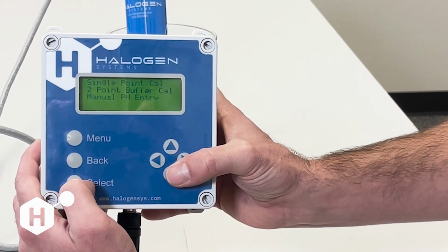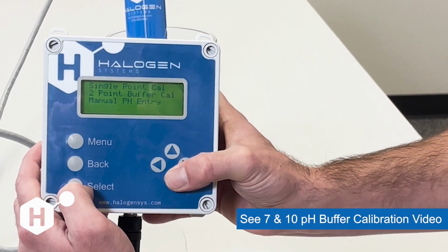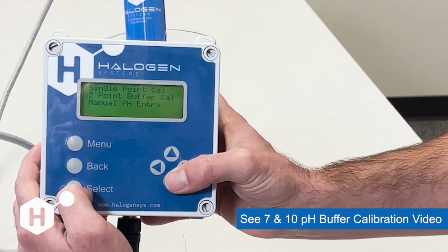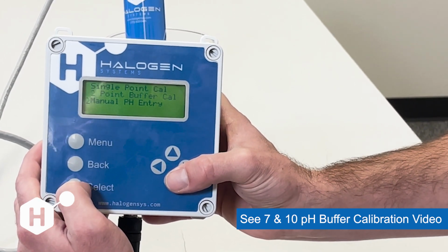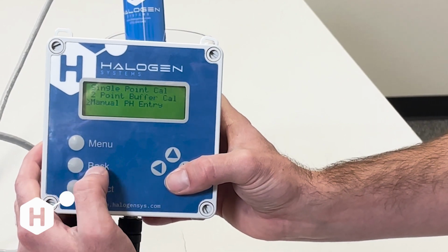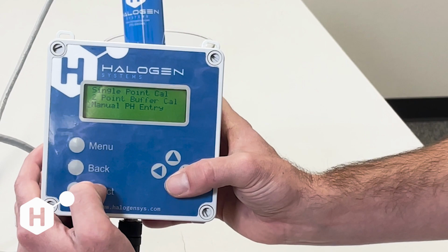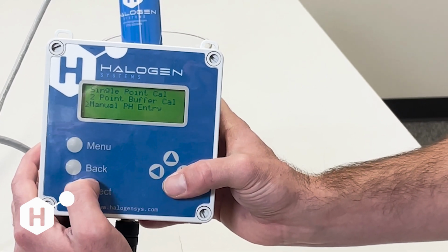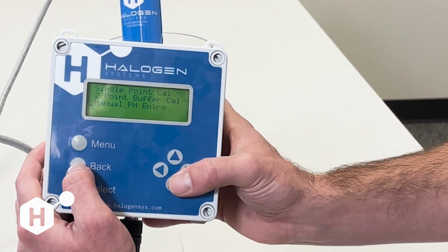We'll also be able to do 2 additional options for pH calibration, and that's going to be 2-point buffer calibration, which I cover in another video, and then manual pH entry. If our pH probe goes bad and you're getting erroneous values, you can use the manual pH to put in what your system is expecting in pH, and we can apply a pH compensation to that value.